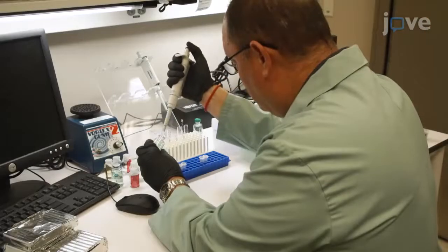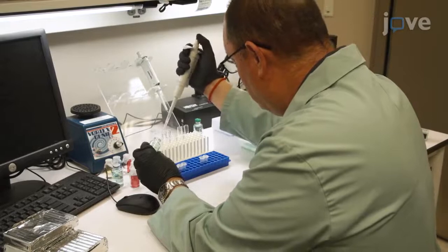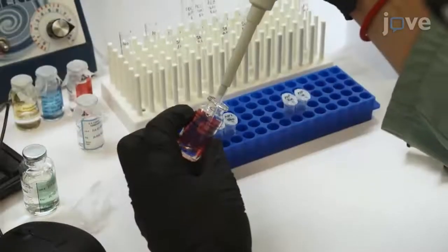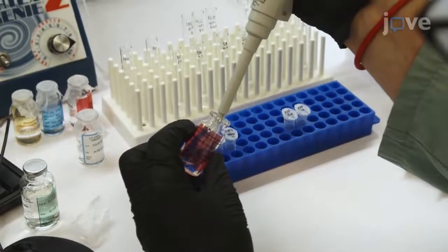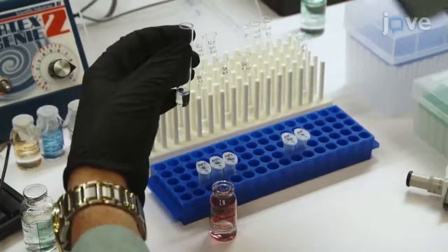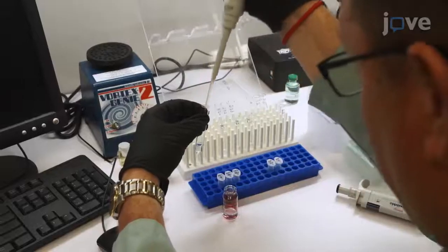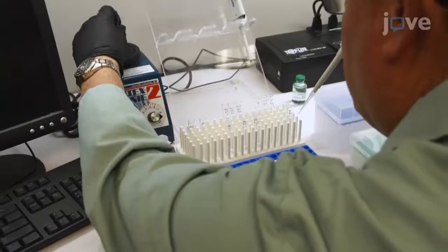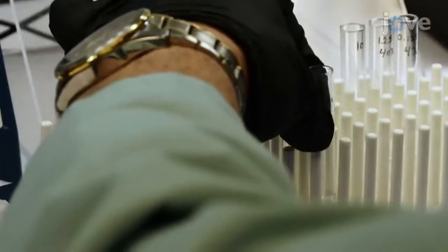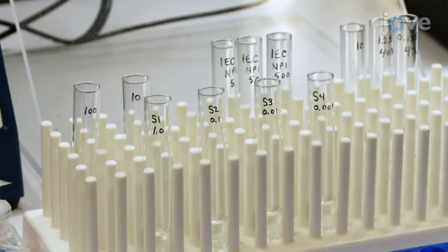Then, using 900 microliters of LAL-grade water and 100 microliters of the 1 endotoxin unit per milliliter calibration standard, prepare a second calibration standard at a concentration of 0.1 endotoxin unit per milliliter. Then repeat the serial 10-fold dilution to prepare two lower calibration standards, to obtain a total of four calibration standards ranging from 0.001 to 1 endotoxin unit per milliliter.